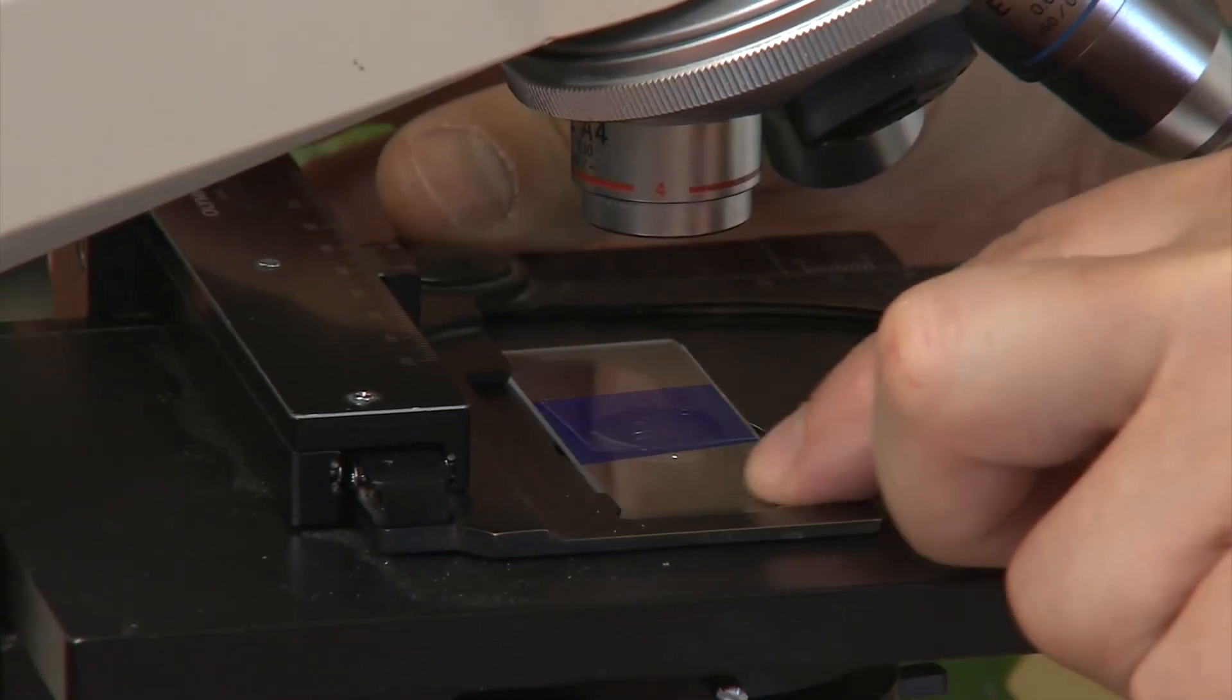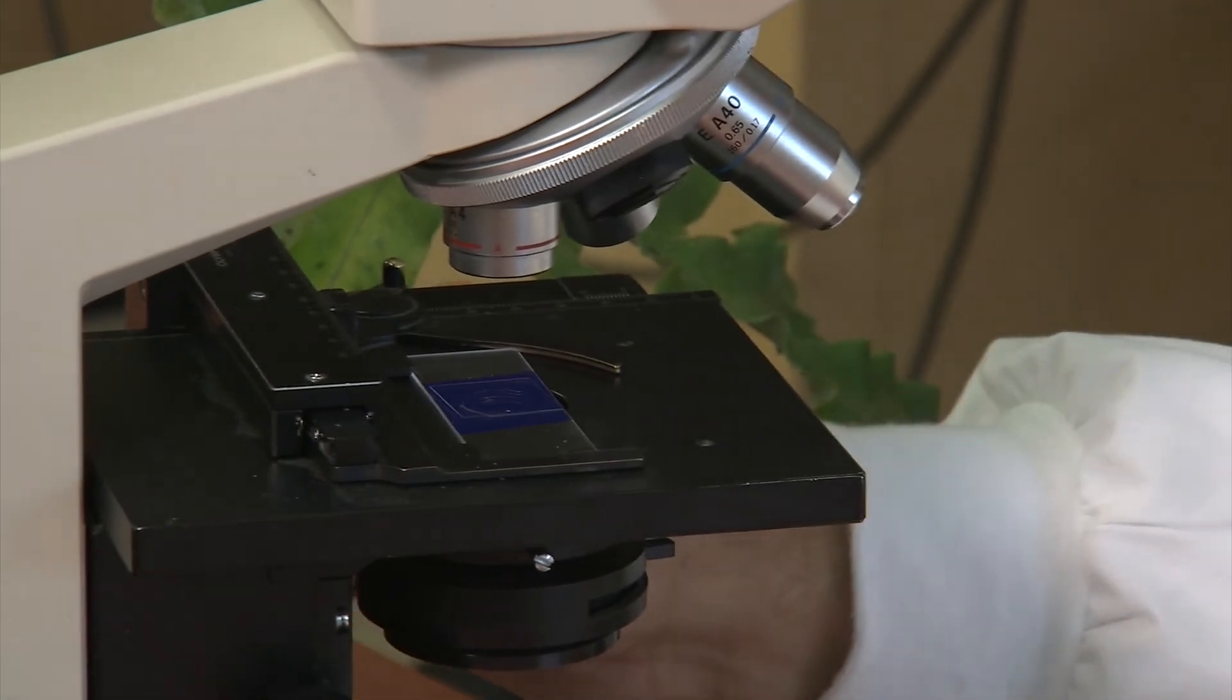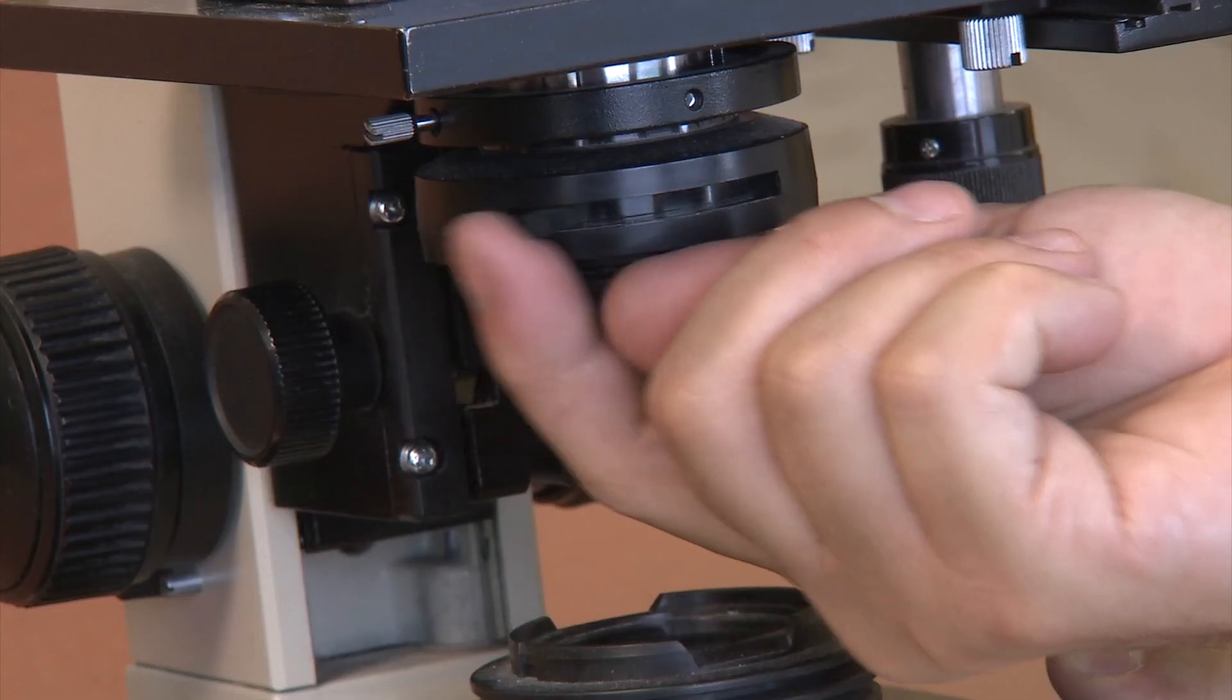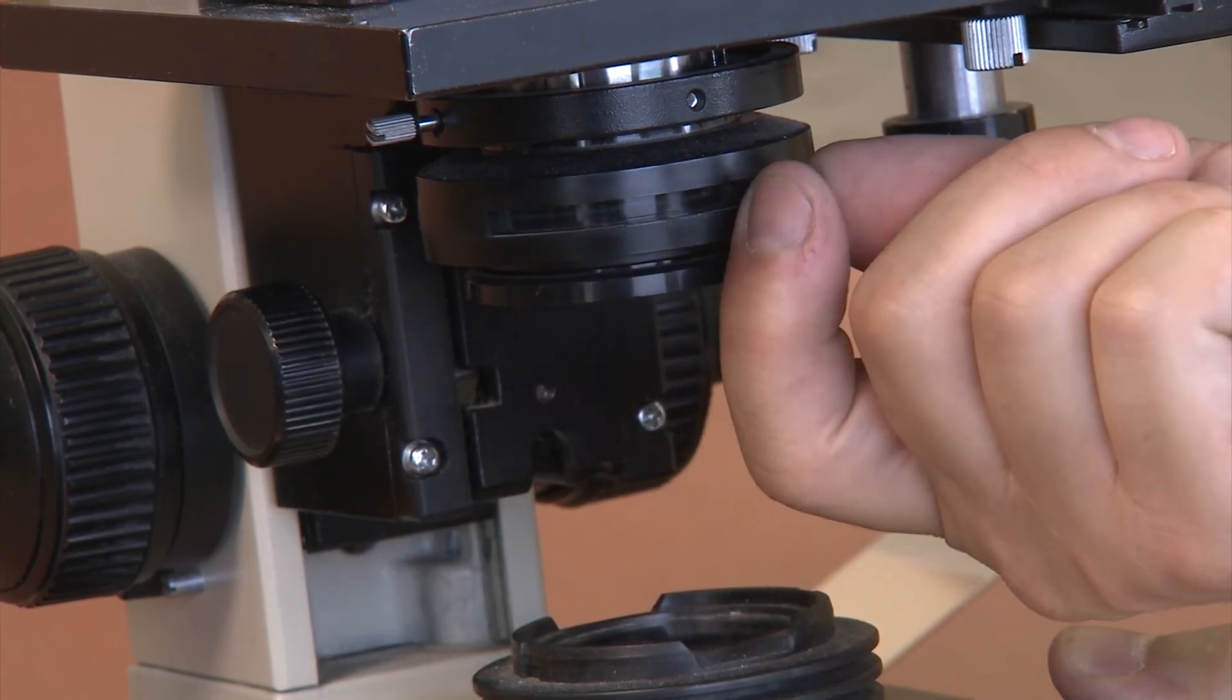When you look at this slide on your compound microscope, remember the basic steps. Start on low power, find something to focus on, even if it is just the edge of the cover slip, and close down the iris diaphragm.